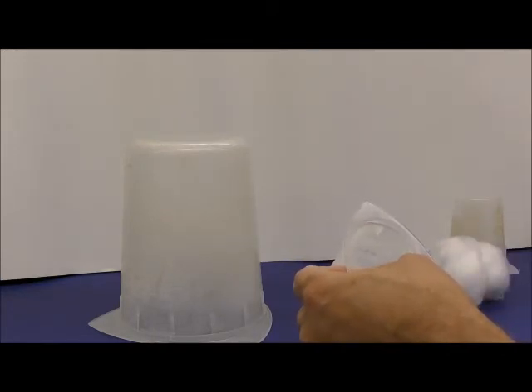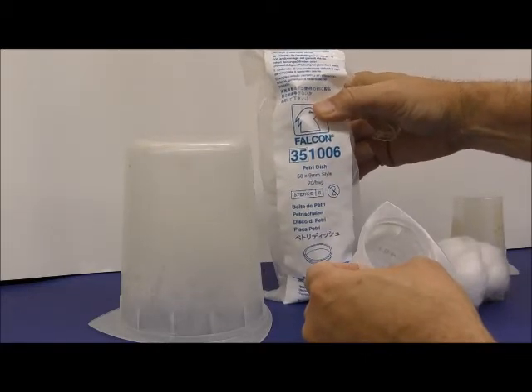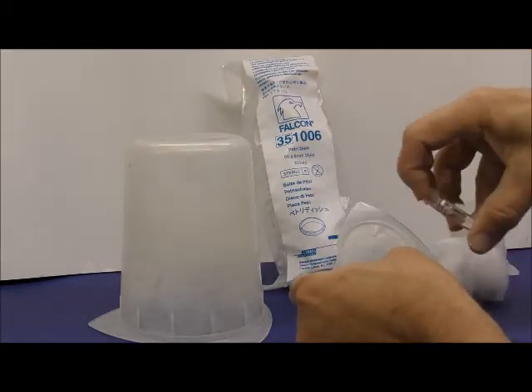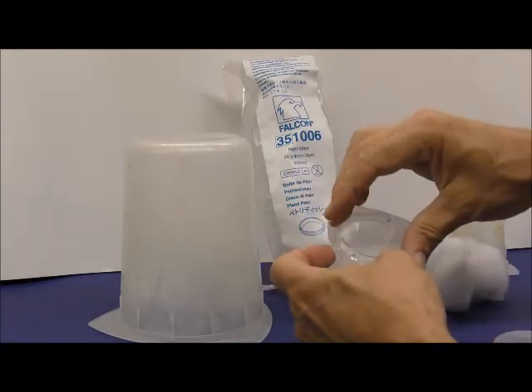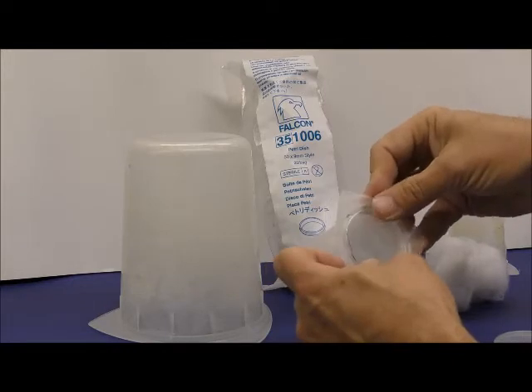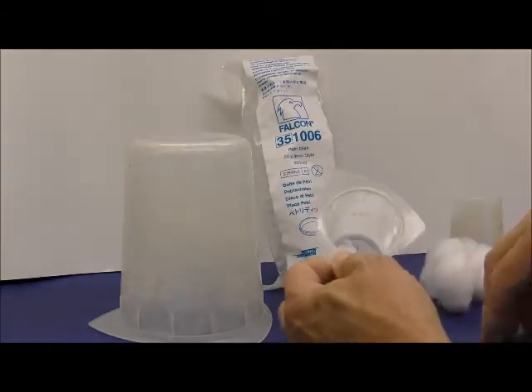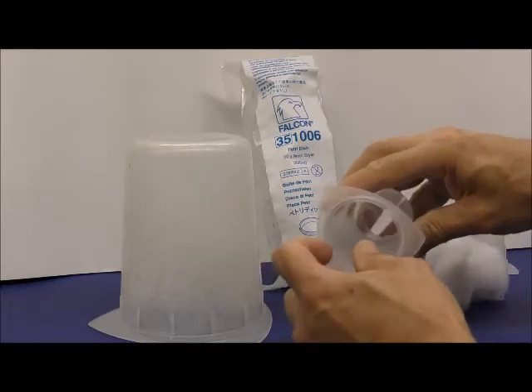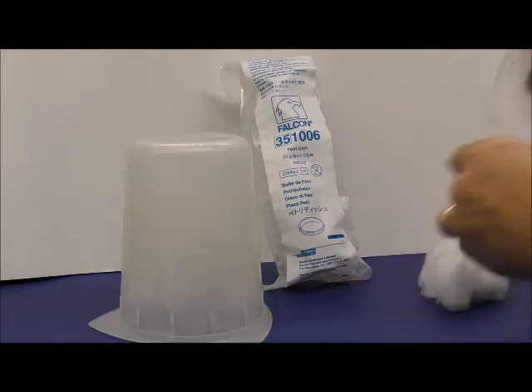You can use smaller petri dishes like these Falcon petri dishes. These are 50 by 9 millimeters, but I find these to be a problem because if you open this up and use the bottom, sometimes they have these little clips that don't allow it to go in. And if it is in, it's too difficult to get out to change between egg pulses. The lids fit really nice, but sometimes they stick, and it's not very thick for the agar. So those are a problem.